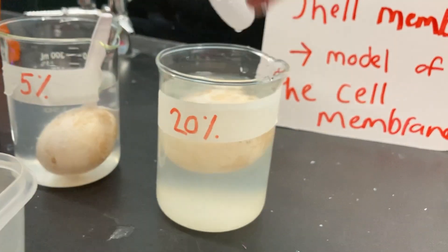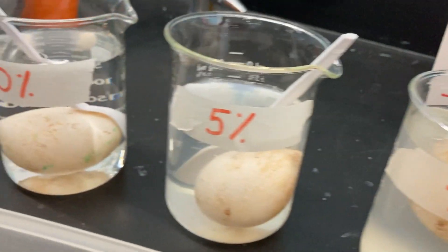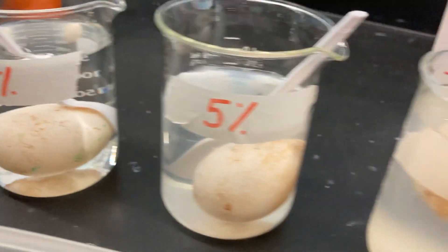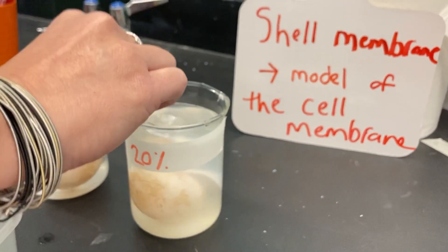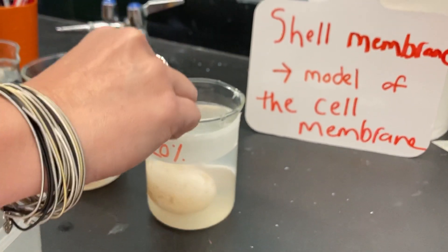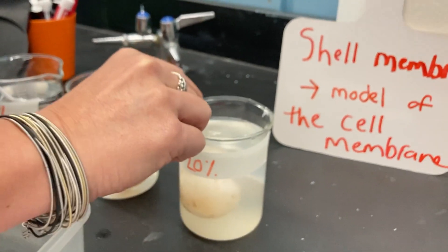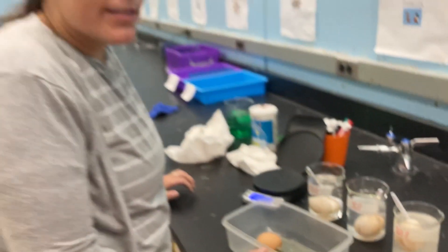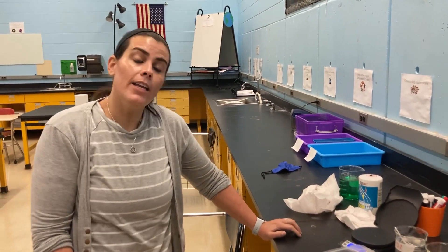When we put the egg into the 20% salt solution, it floats — the salt changes the density of the water. I'll use this little spoon to try and keep it submerged as much as possible. We're going to let this set for 10 minutes, then we'll come back and take the mass of our eggs again and see what happened.